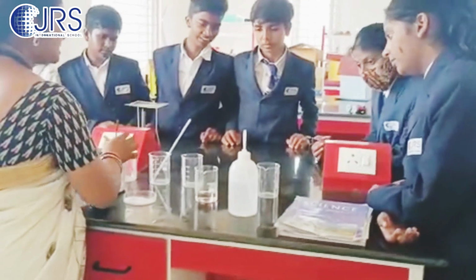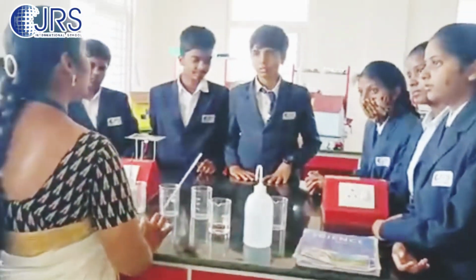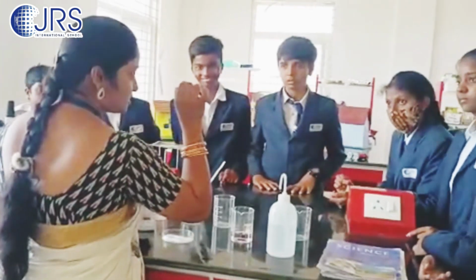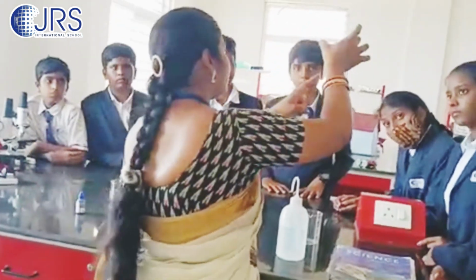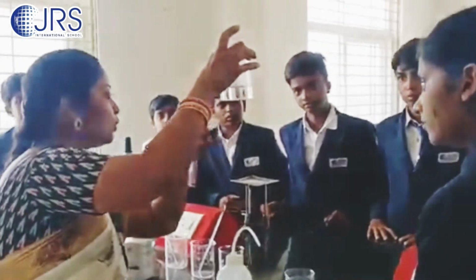Yes. This means the particles are very small in size and still they are showing the properties of the whole compound. Actually it is in purple color. We just added a pinch, that's it, but still it is coloring the whole water. Yes or no? See here the particles are moving. That's why the color is spread throughout the water.